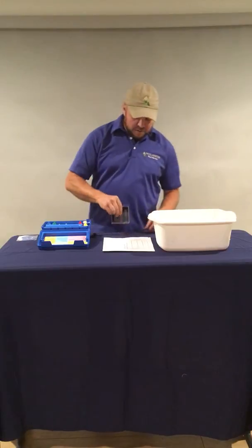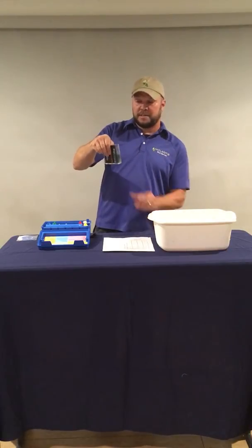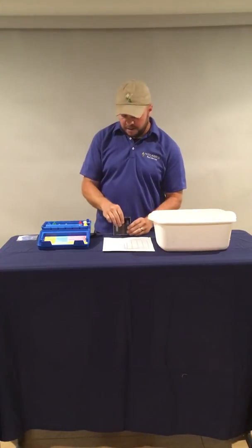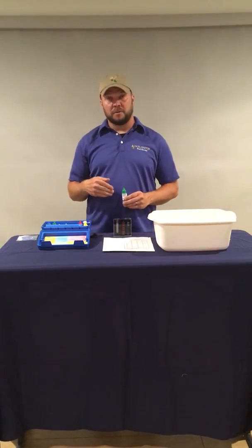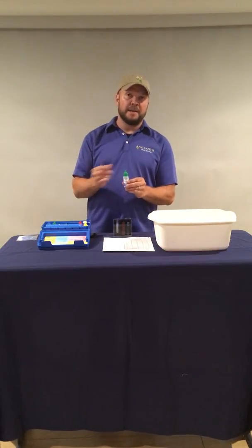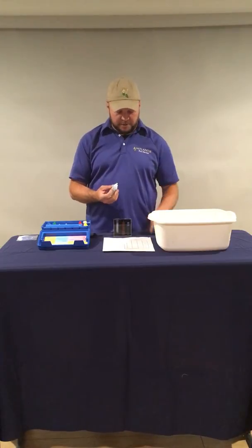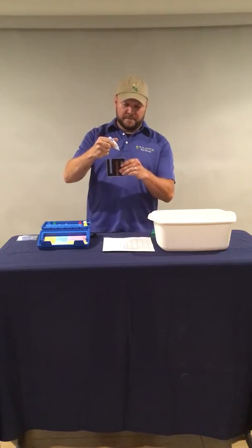Now what we're going to do is we're going to swirl that sample, and if there's total alkalinity present in the water, the sample is going to turn green, which you can see that it has turned green. Now what we're going to do is similar to the test that we did for the chlorine. We're going to add the R9 drop-wise and count the number of drops that we add. And after each time we add a drop, we're going to do a little swirl, mix it up.